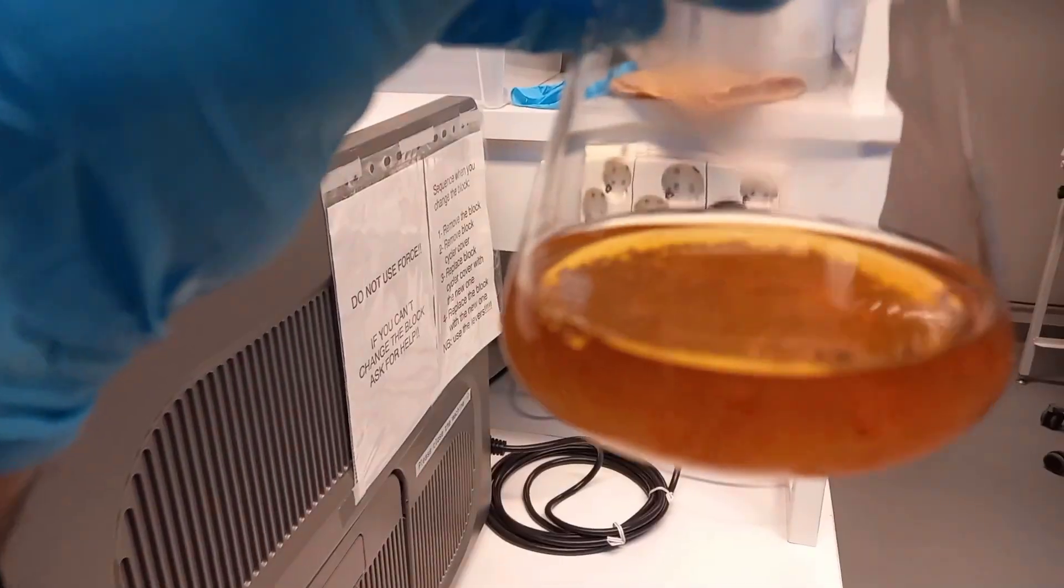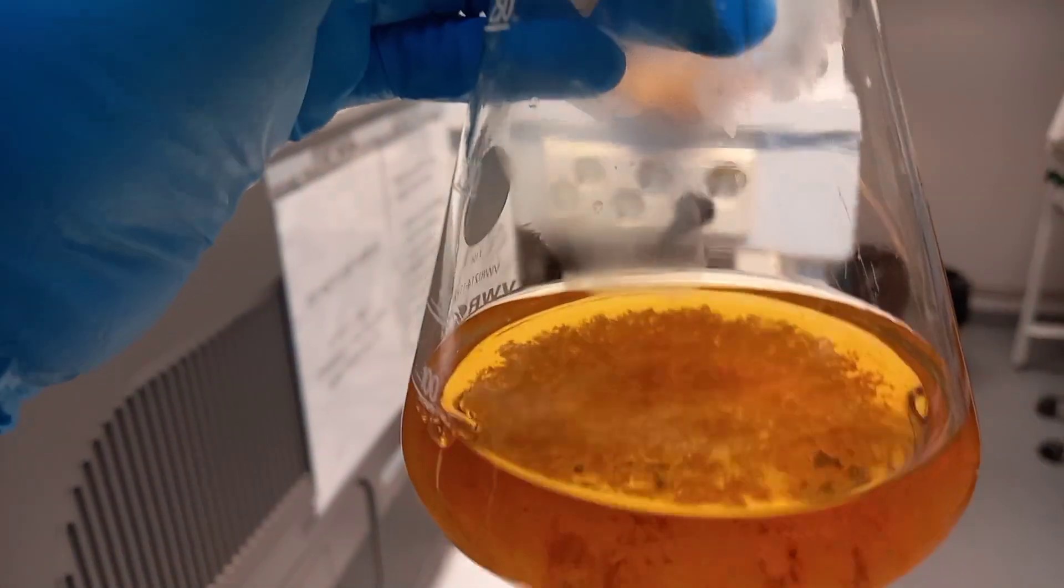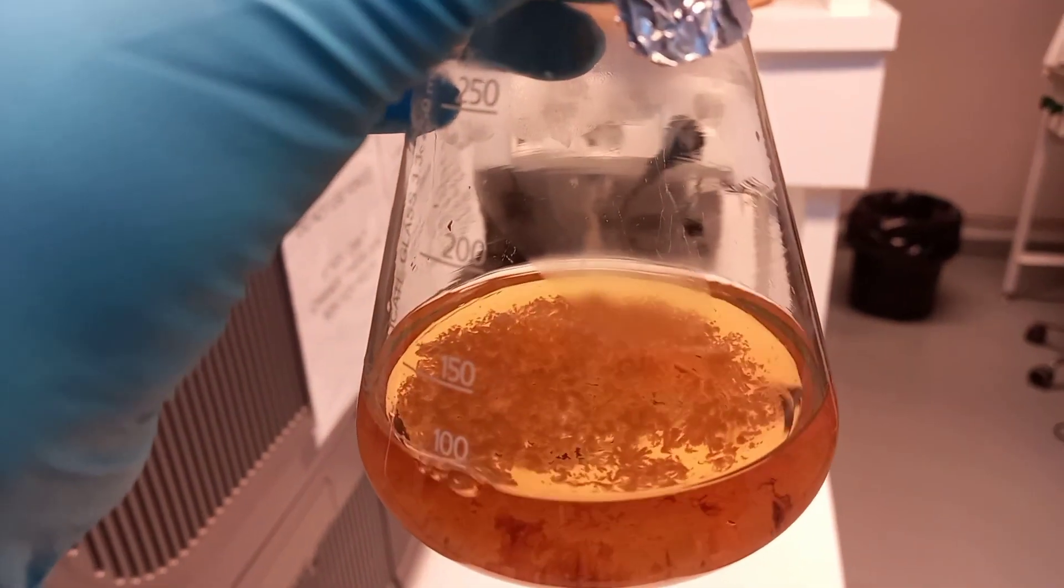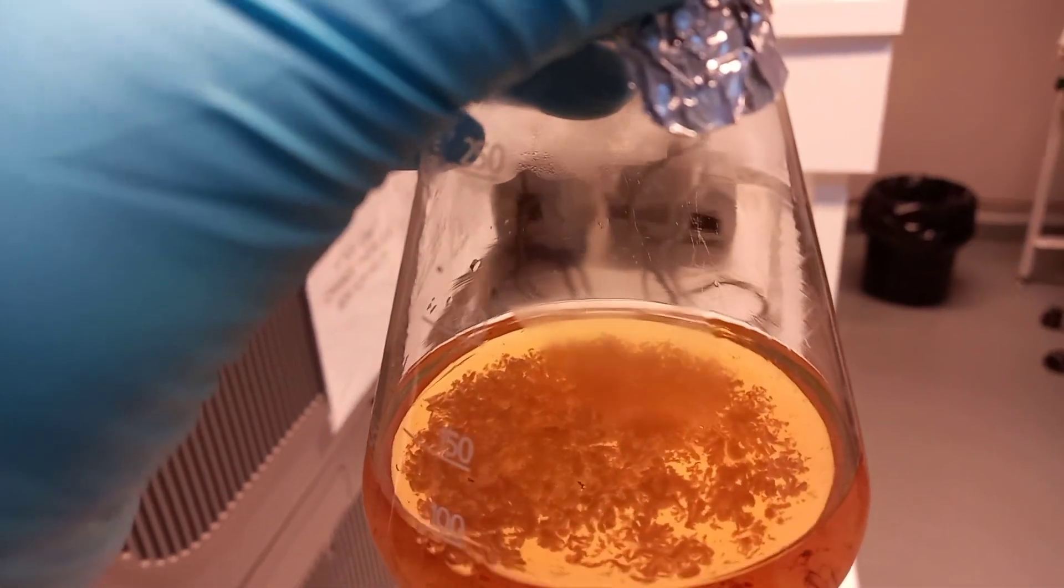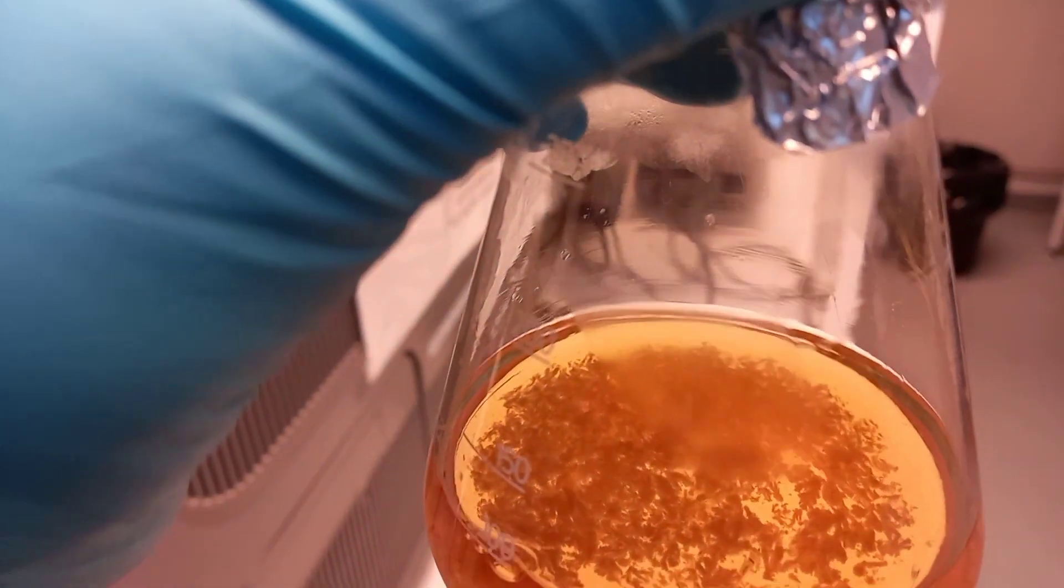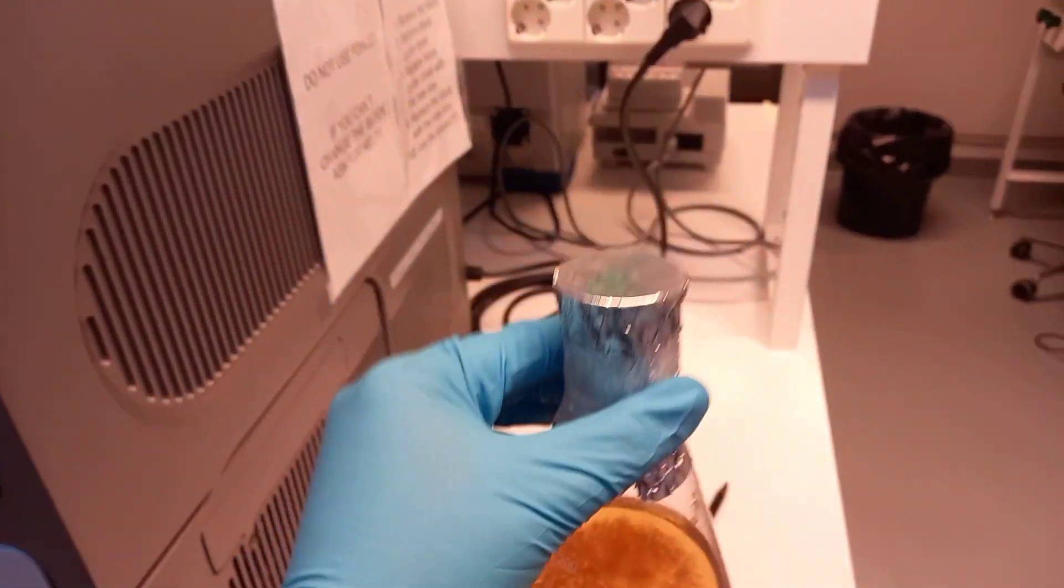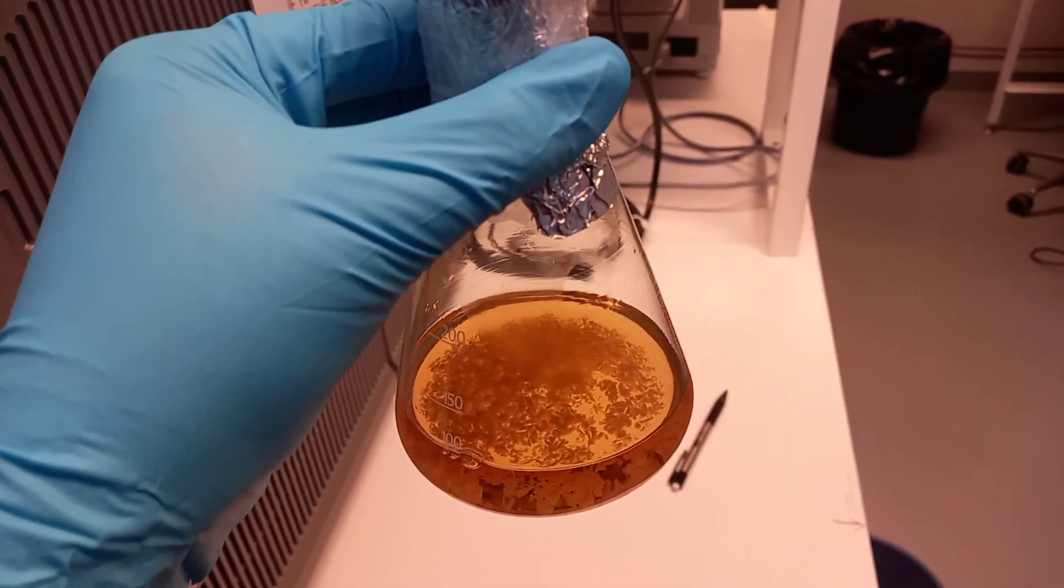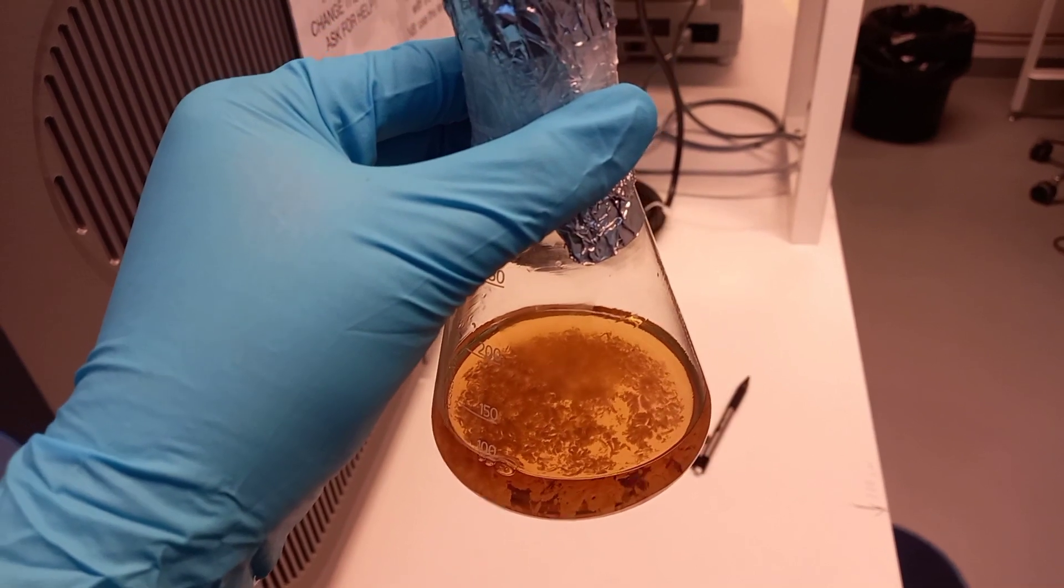Like fungus, they make branches or connections with each other. From the top you can see their pattern of growth. They have been put in a 300 ml flask to grow because I wanted to give them more area to spread and release secondary metabolites that I will be analyzing at the end of the experiment.